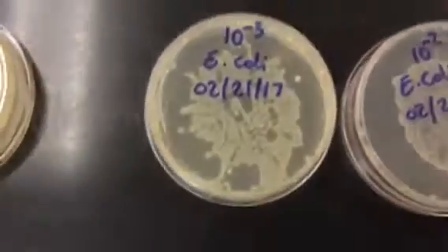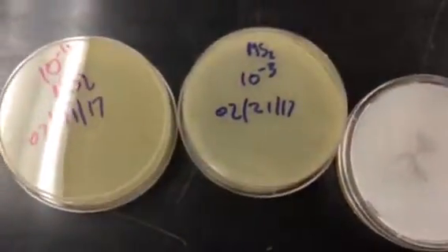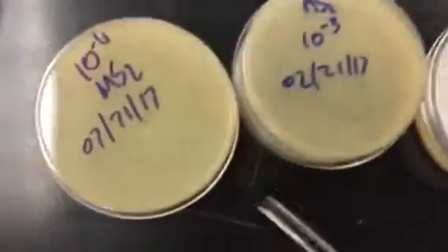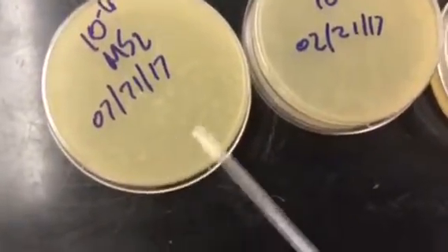You can also look at the difference between these, like if you just have this E. coli here and you smell it versus the odor of this MS2, they're going to smell a little different. The one that is MS2 is actually the bacteriophage that's kind of chewing up and lysing the E. coli. So this is another good one.